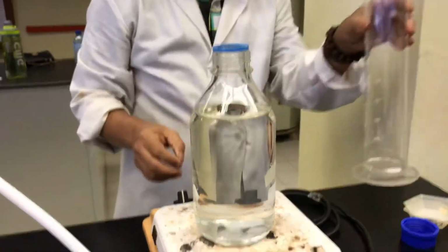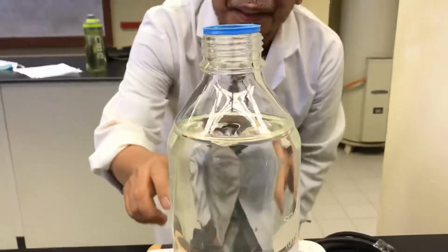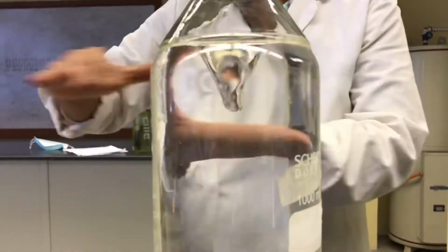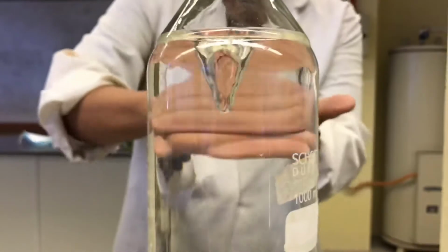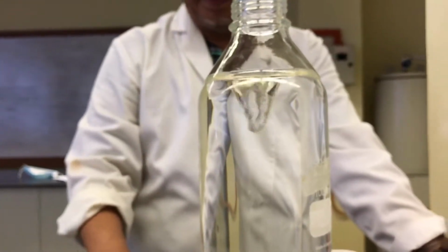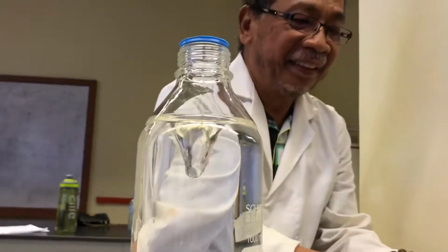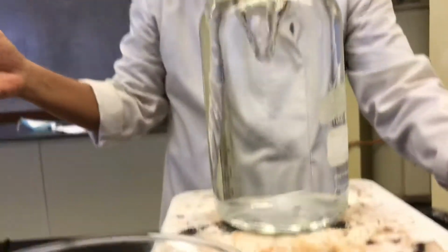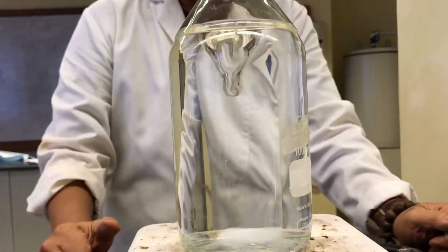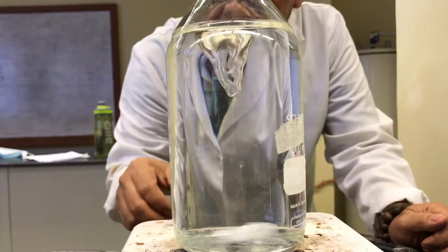Then it will become like this. The 6 chemicals inside there, and it looks good. Okay. I just showed you the 3. We can do everything, and then after that you are satisfied that it's all mixed together.